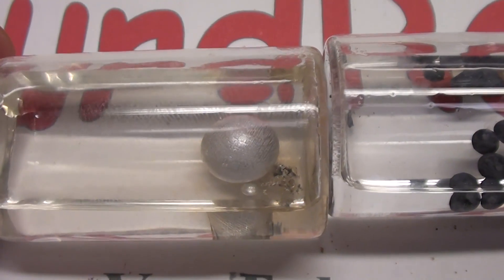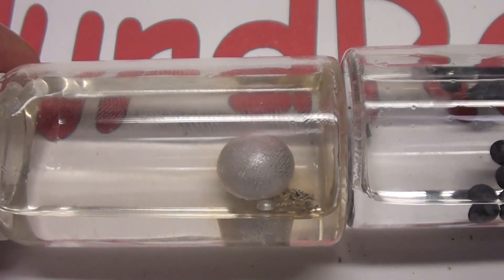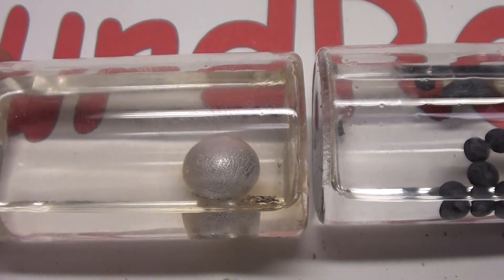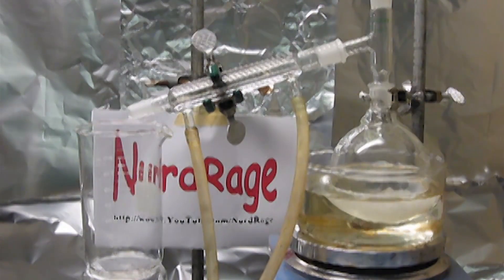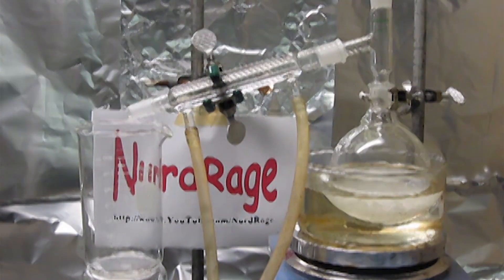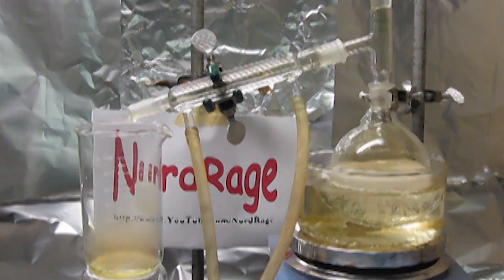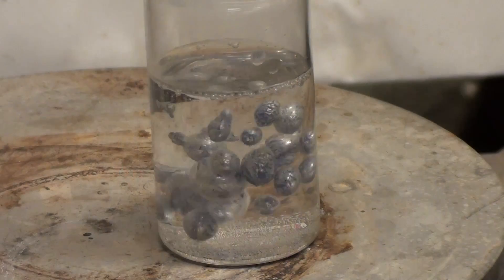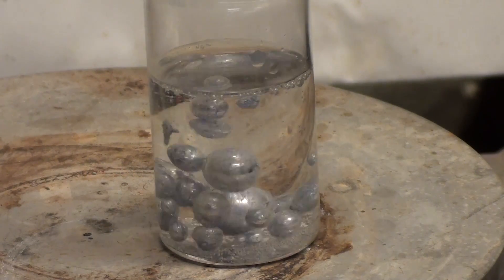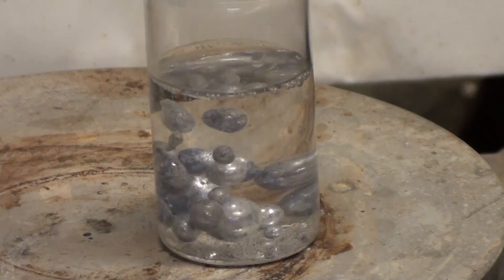It's very inert and also commonly used to store reactive metals like lithium or potassium. It has a low volatility, almost no odor, is non-toxic, and is quite safe to handle. I've grouped it as lab equipment because it's almost never used as a chemical reactant.